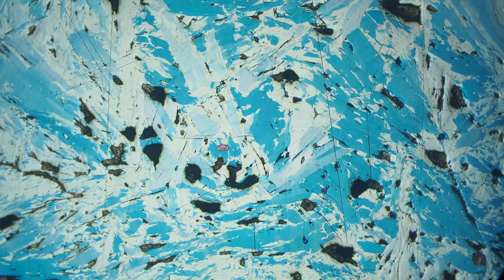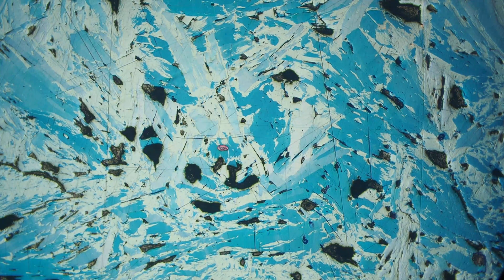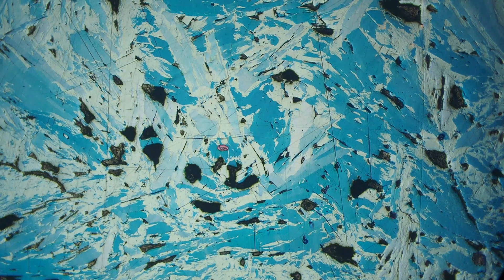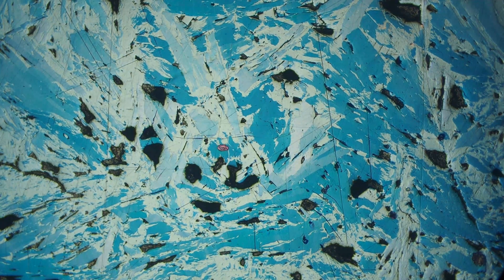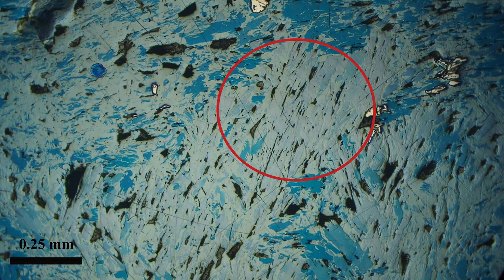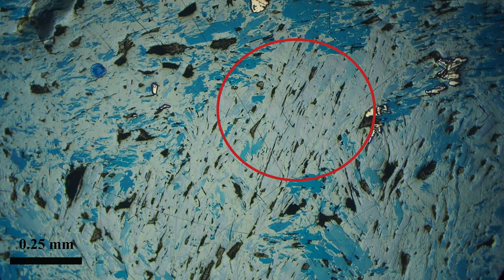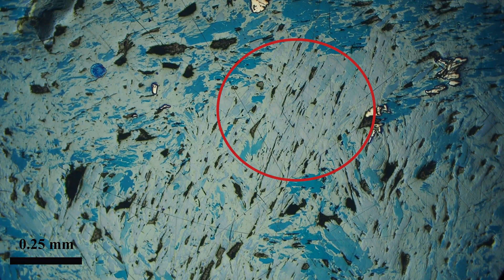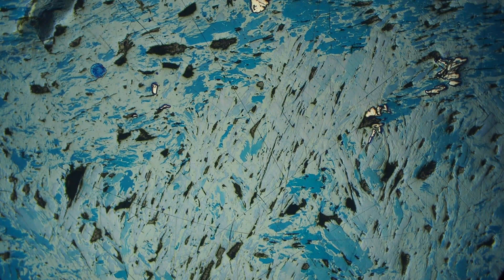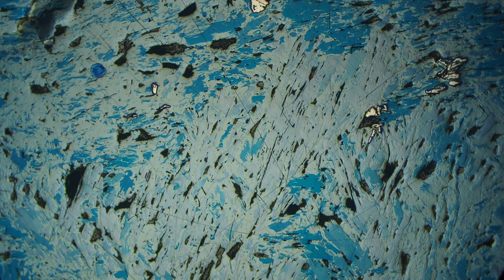Another thing to note is the radiating crystals, which is fairly common for covellite. We're going to go through a few different parts in different samples and we'll be seeing the same sort of thing. Again we have these radiating crystals.